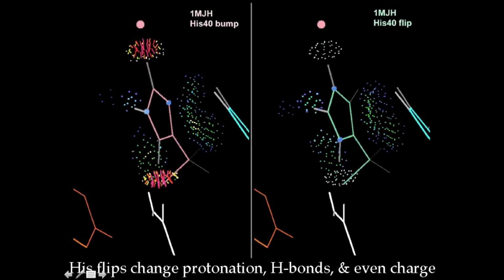And using these contacts is really valuable for getting local conformations correct. So for instance, here's a histidine that's at the active site of this structure, and it's got 2 really horrible clashes. One is to a water where you could imagine the water may be wrong, but the other one is to an obligate acceptor, that carbonyl oxygen on the backbone.